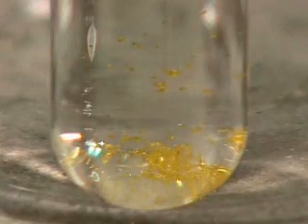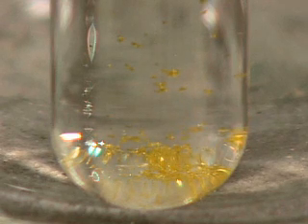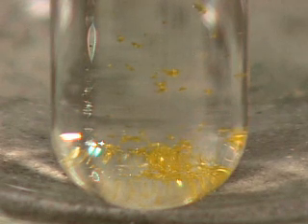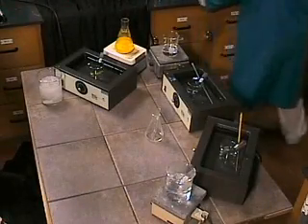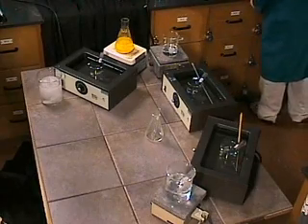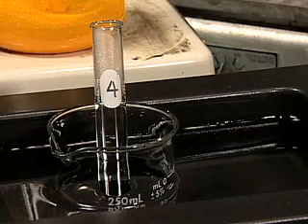In the test tubes where cooling takes place, yellow crystals of lead-2-iodide form and settle to the bottom. The test tubes remain undisturbed for one hour. This ensures that equilibrium is established for each temperature and that the solution above the crystals is saturated.